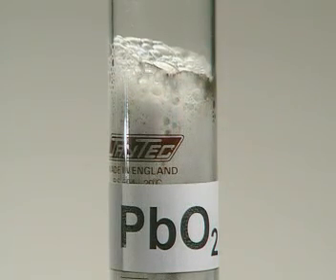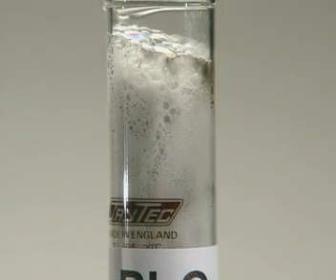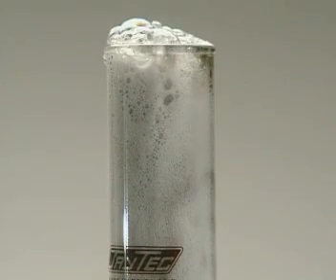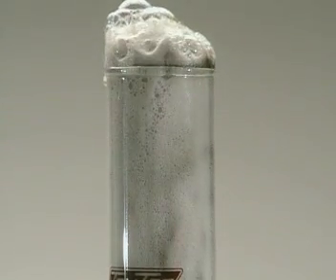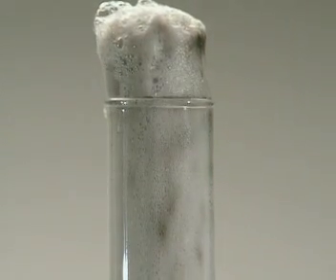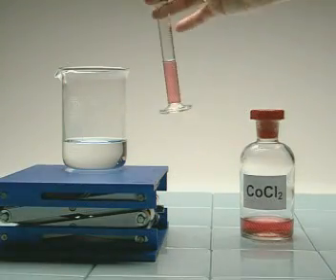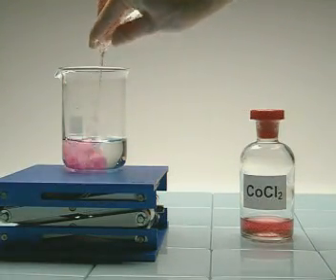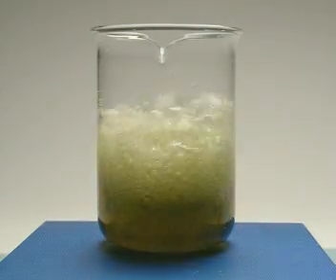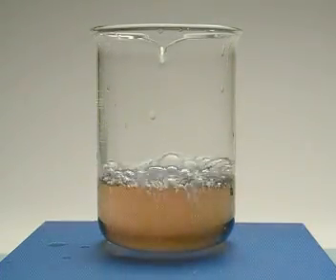Lead oxide is much better than the rest. Specific catalysts are used to speed up specific reactions. Cobalt chloride solution is the catalyst in this next reaction. A catalyst is a chemical that takes part in a reaction but doesn't get used up.